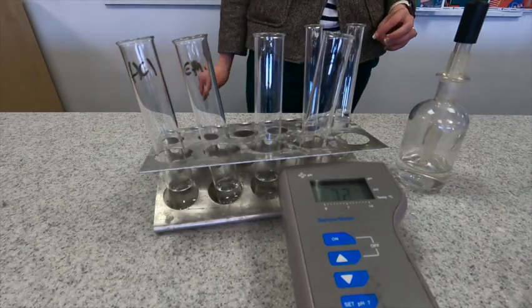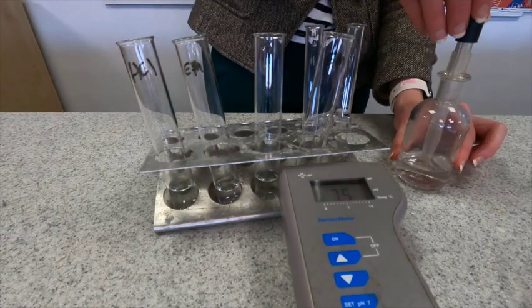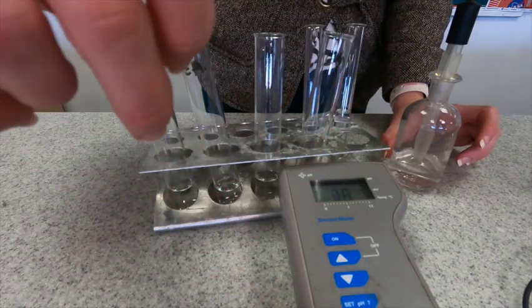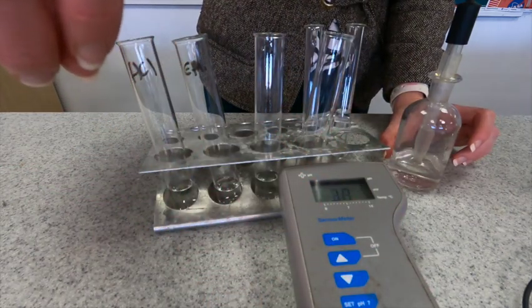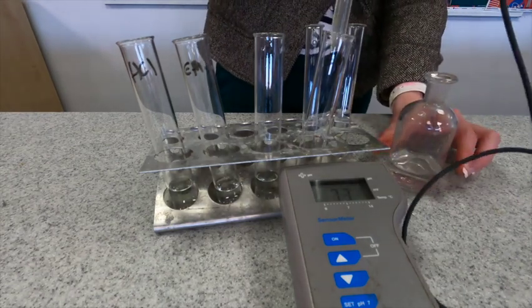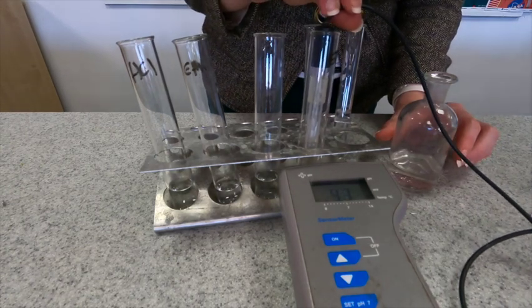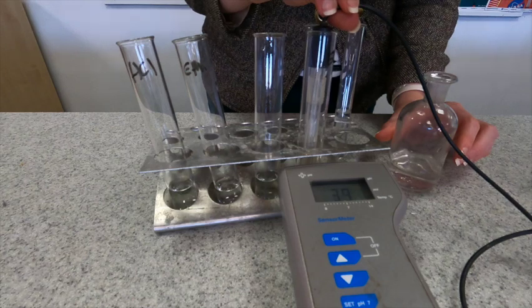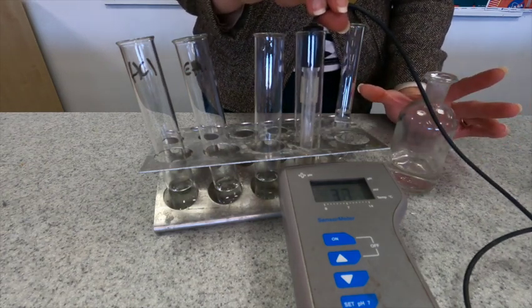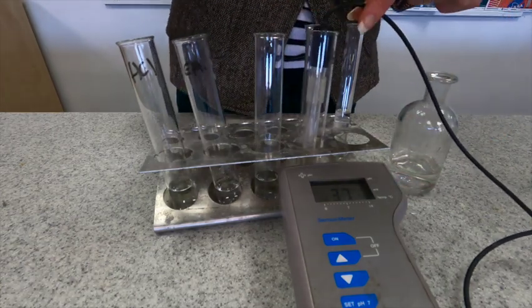Now we are going to take a look at the pH of our ethanoic acid after I have reset the pH meter. So I've reset the pH meter and now I can have a look at ethanoic acid. I'm expecting this to be a higher number than the hydrochloric acid, and we can see there that this is a much weaker acid. It's hovering around 3.7 on the pH scale, so much weaker acid than the hydrochloric acid.